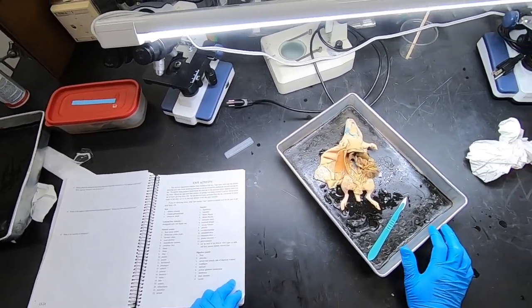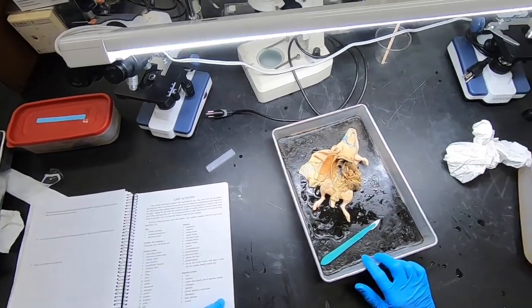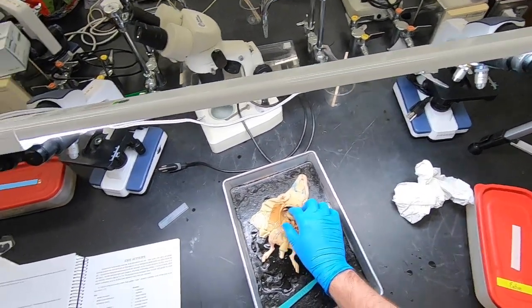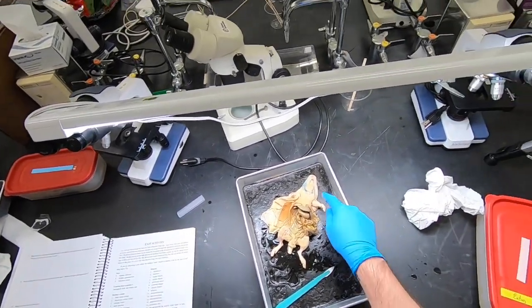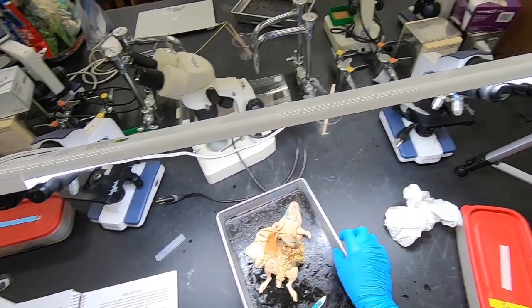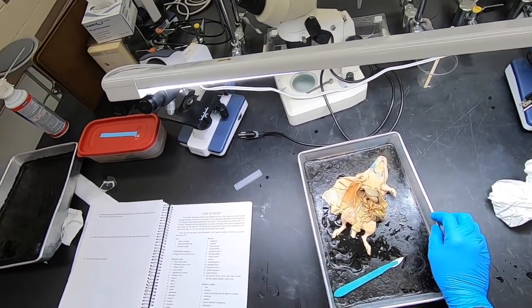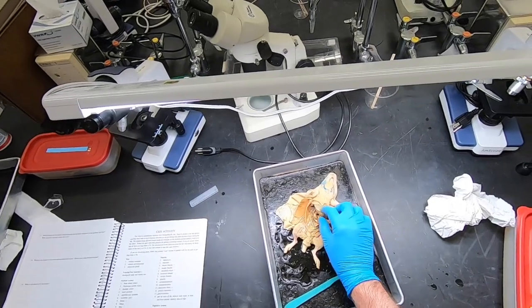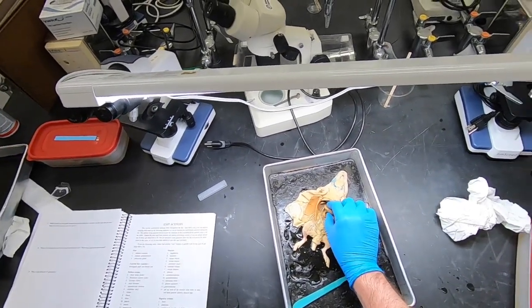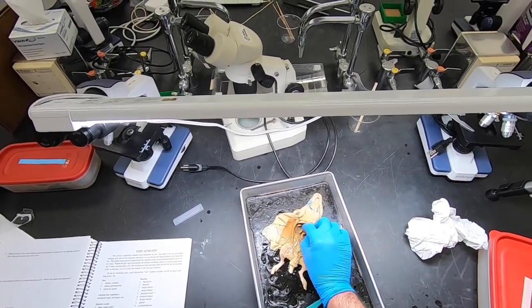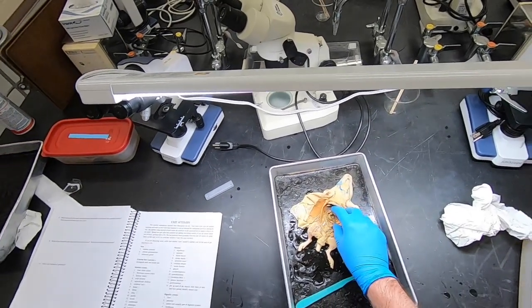Let's make sure we got that: liver, pancreas, spleen, esophagus—which brings the food from the mouth down to the stomach. The pyloric sphincter constriction is at the end of the stomach, preventing food from getting into the duodenum.